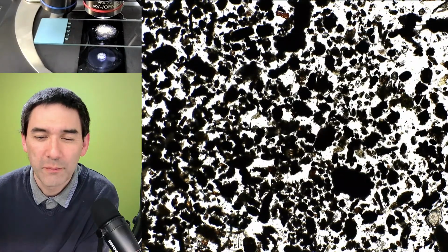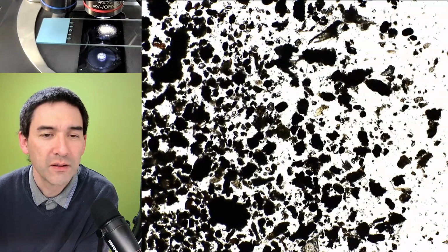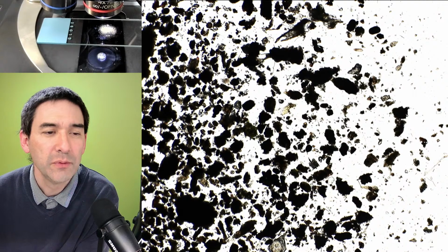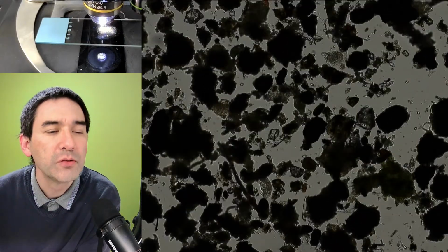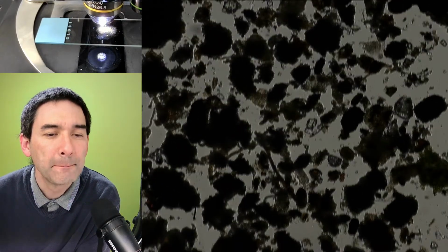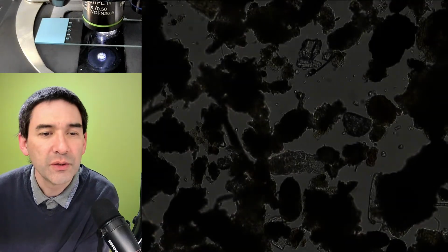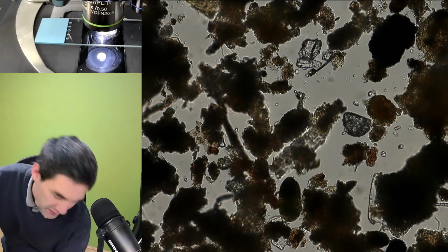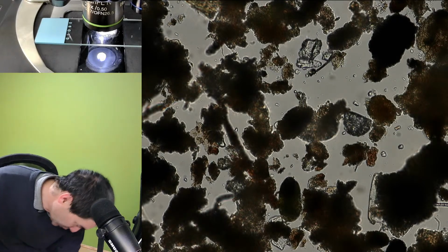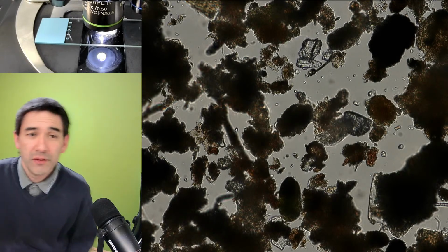How large are water bears in microns? Ooh, there are different sizes. Let me do the following. I have a suggestion. Where is the water bear again? Let me try to find it. Here it is. Okay, so here is the water bear. And just a second, I'll disappear for one second and then I will reappear.